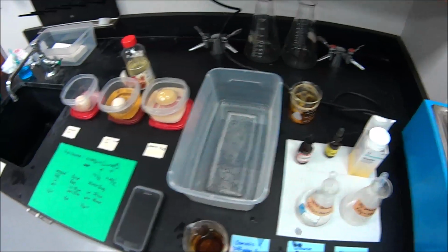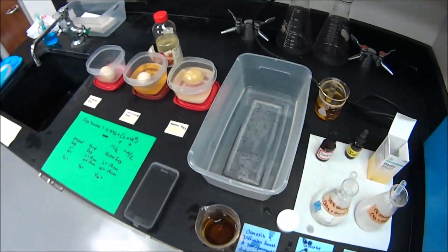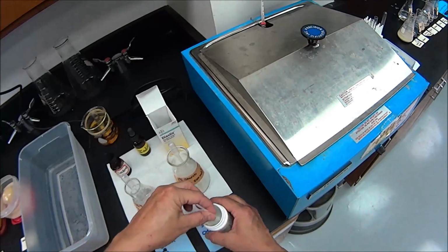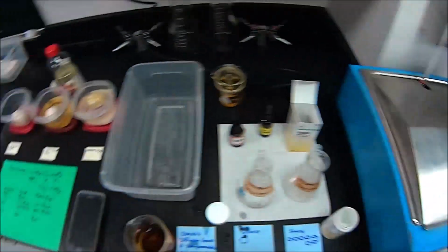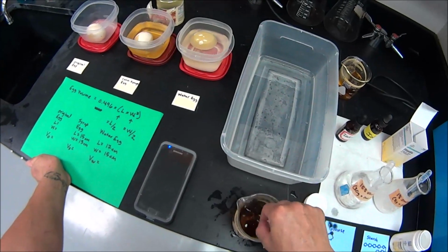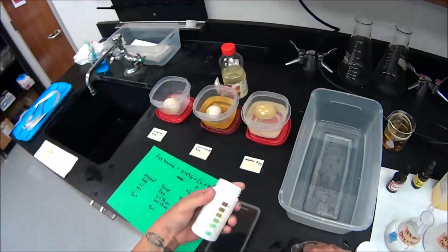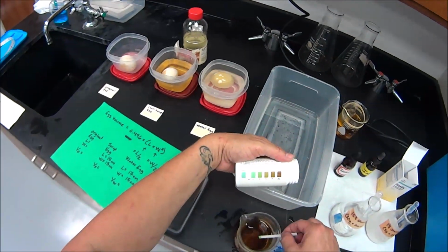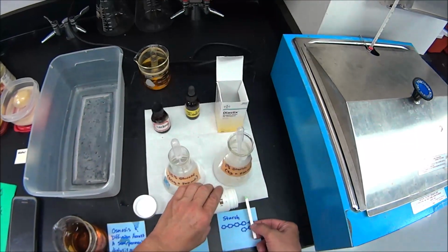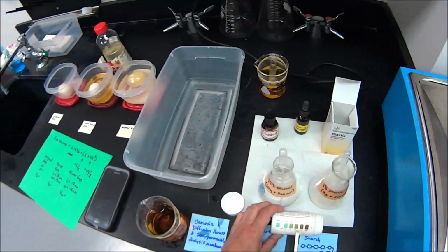Okay, now we want to know, did glucose leave the bag? We know starch didn't. So we're going to use a test strip here. There we go. I'm going to swish it around in that water really good and give it a minute to react and see. Originally, that test strip was almost turquoise. Okay, we're going to give it a minute because these are some old strips. So if that turns a level of green or brown, we're going to give it a second here.